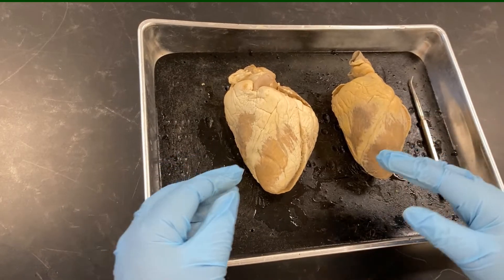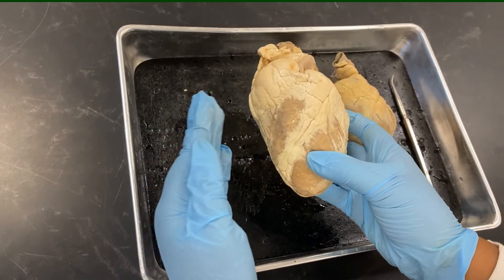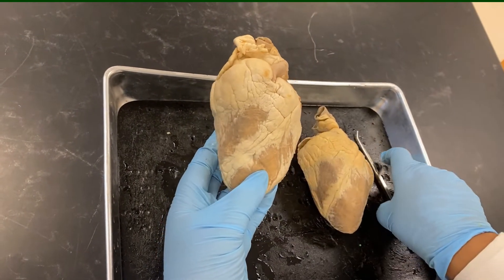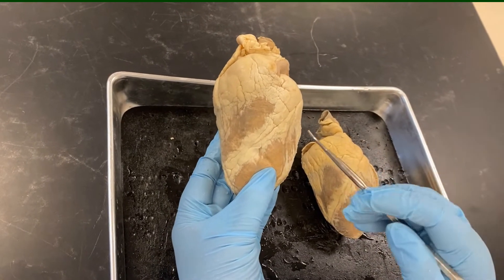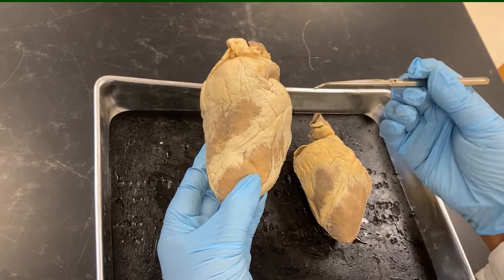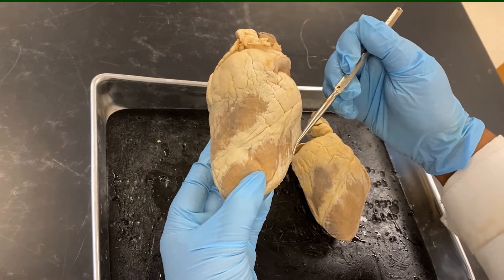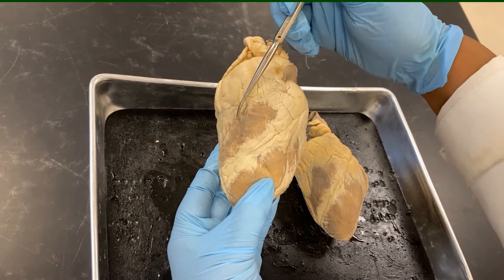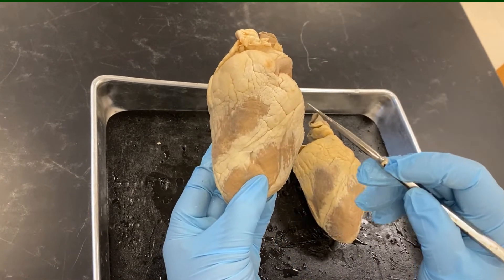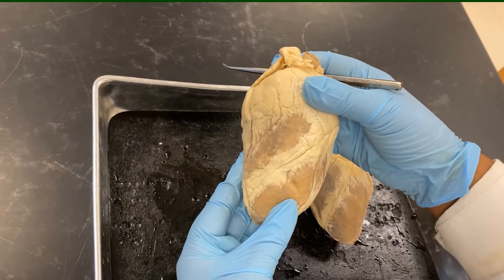When we look at the external anatomy, the very first thing we have to be careful about is the sides of the heart — left versus the right. So this is an anterior view. There is a diagonal line that is the separating area between the two ventricles. So this is the left ventricle, this is the right ventricle, and this is called the interventricular sulcus, through which passes the branches of coronary circulation.